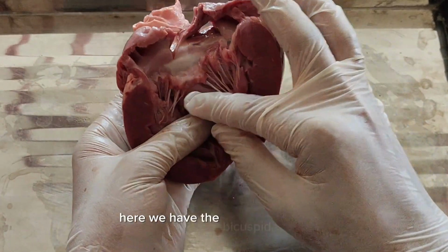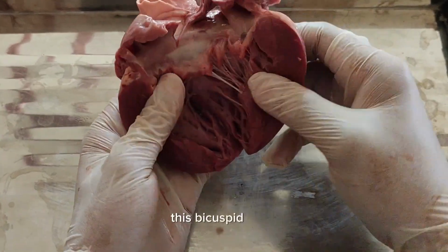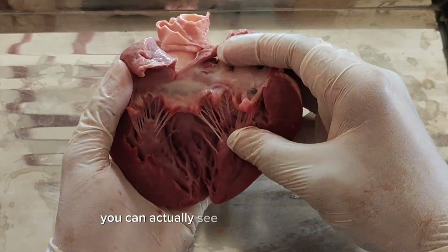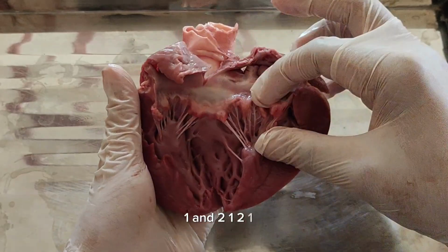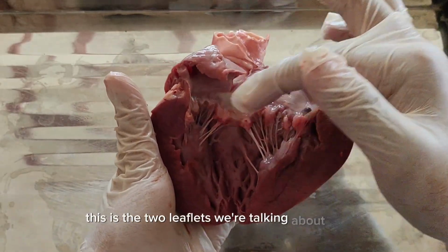Here we have the bicuspid valve, everyone. This is the bicuspid valve. We can actually see two leaflets right here, one and two. These are the two leaflets that we're talking about, which is the bicuspid valve.